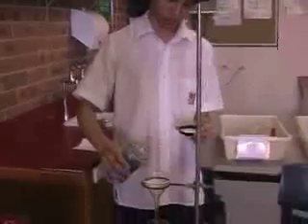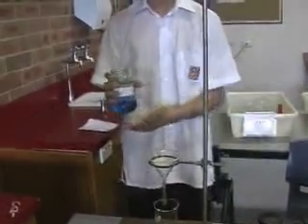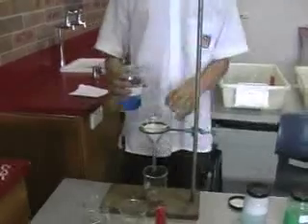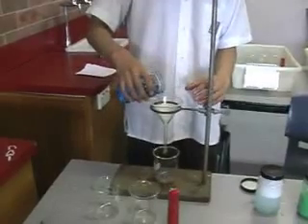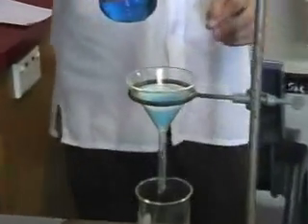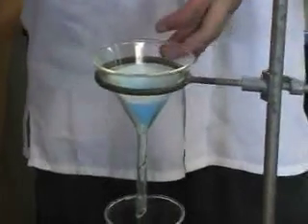Right now I'm pouring liquid A into the filter paper. Now what would you expect to happen with liquid A? I would expect all the liquid to go straight through — it's a solution, so all the particles are already dissolved in it. You'd expect it to go through unchanged. Is there any trick to doing this or is it just an easy thing to do? It's just an easy thing to do.